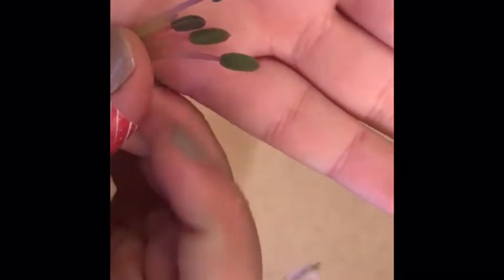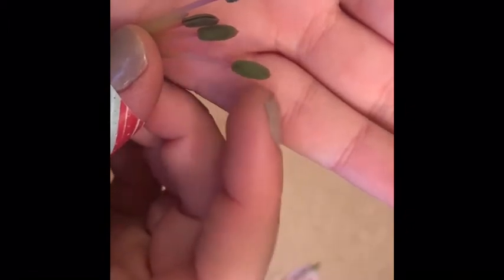We are going to take off these really beautiful petals to get a better look at the reproductive parts. So if you ever wondered what these bits were, that's what they are. They're the reproductive parts. So we have three various looking objects here, but two of them are the same. So if you can see, these kind of look like a cattail, like if you were at a pond, these would be kind of sticking out from the water. This is the anther, and this is the filament, and together it makes up the stamen, which is the male part of the plant. This is also an anther. This little piece here is also an anther, and this is also a filament, which makes up a stamen.